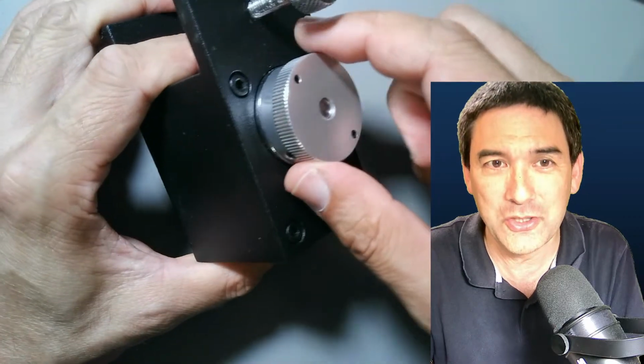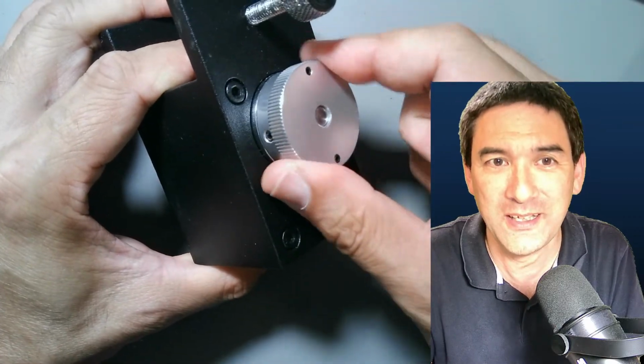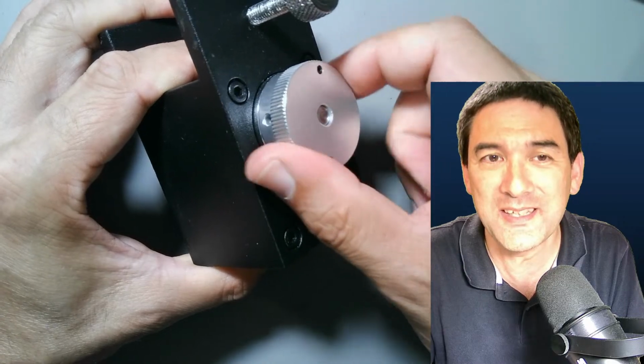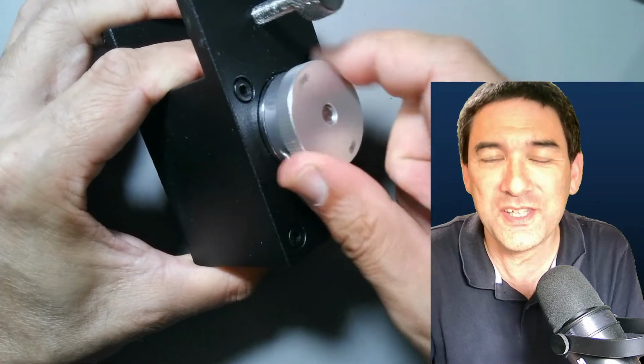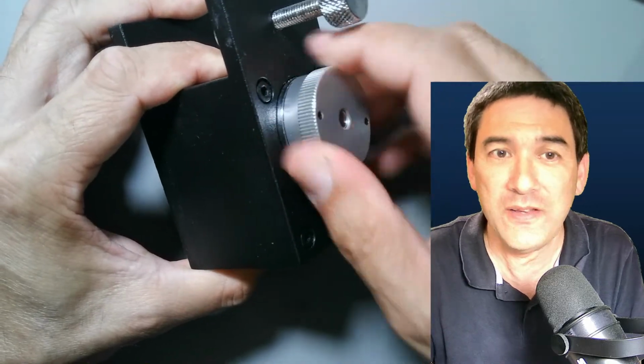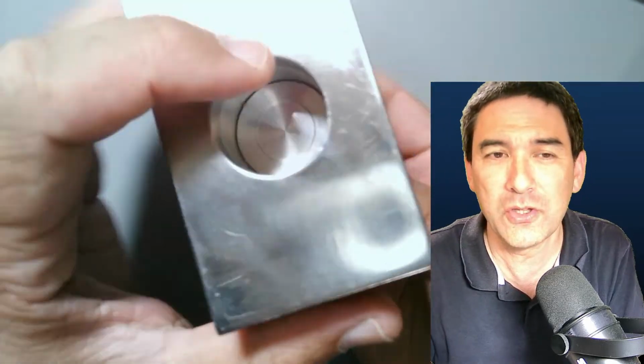But look, I just want to show you something. If you rotate this, you actually see this? It actually locks in place stepwise. And there are zero tolerances, so nothing wobbly at all. So it makes a very, very solid impression.